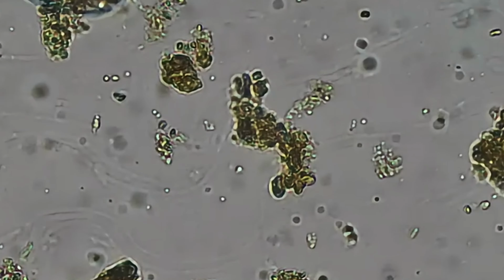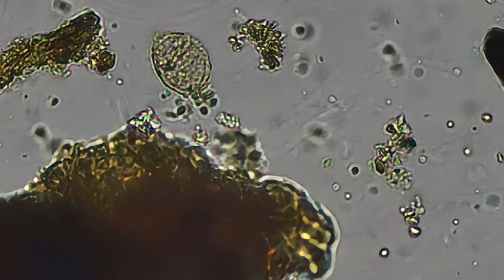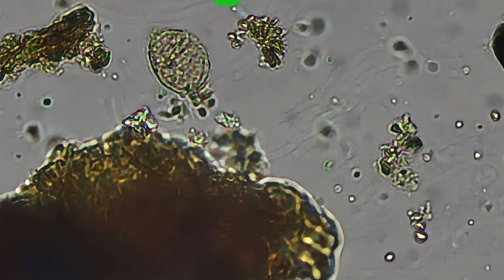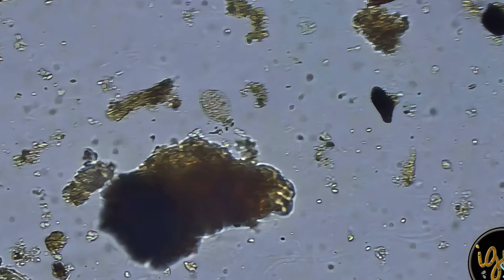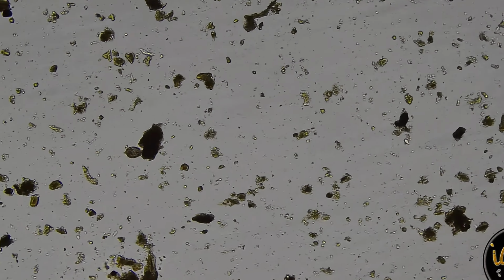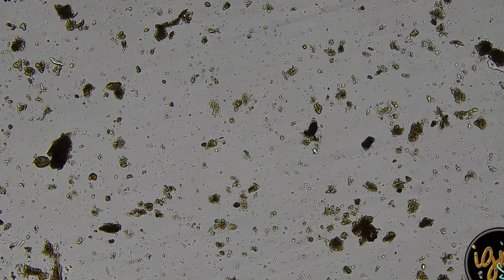I'm not sure what this may be here. Looks like it may have some type of life. Let me turn my light on. See if it, yeah, you can see that it's just kind of got something in it, like little dots and specks. Anyway, so I'm gonna back out to 100 times magnification, and let's kind of sift through this real quick.